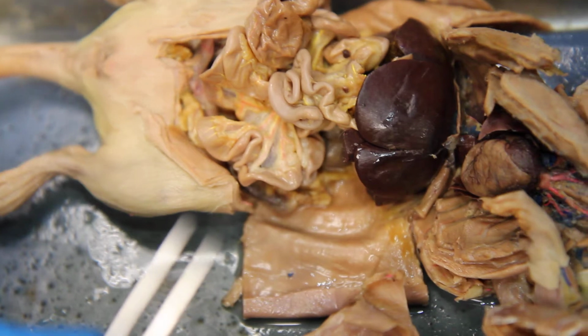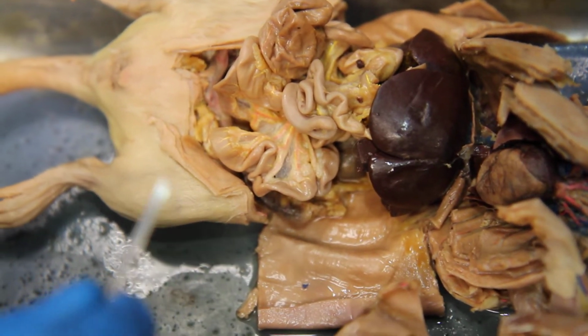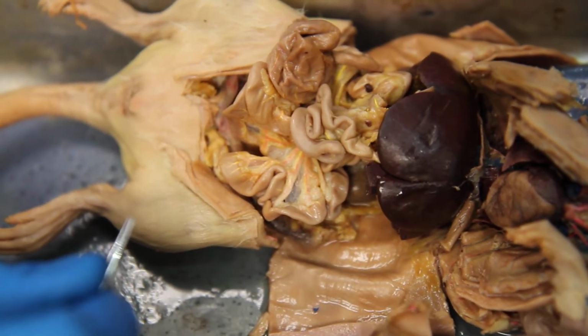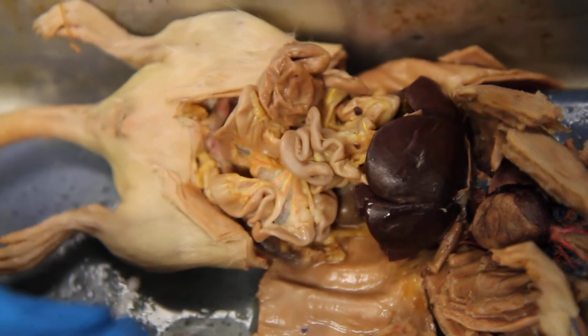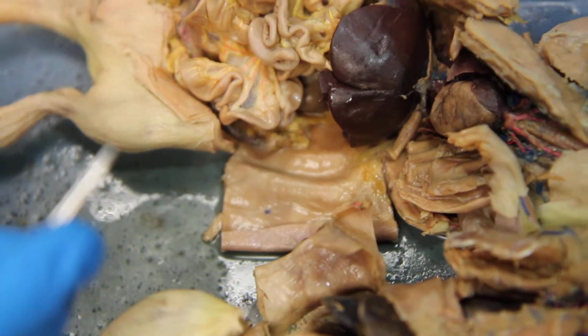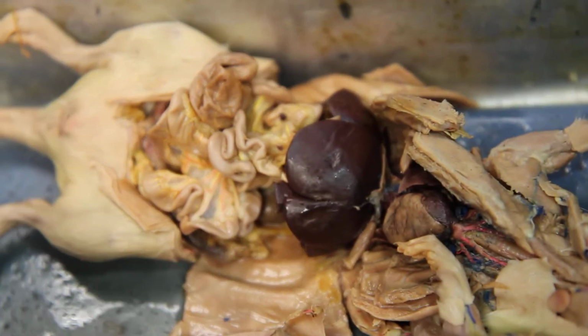On the manual here, every time it says A, that's artery. But if it doesn't say artery, you don't have to put it on the test. So that cranial mesenteric is one of the ones that you don't have to put artery next to. What is it? It's just the cranial mesenteric. It's an artery called the cranial mesenteric. That's fine. Just because it doesn't say cranial mesenteric A next to it, that's okay.